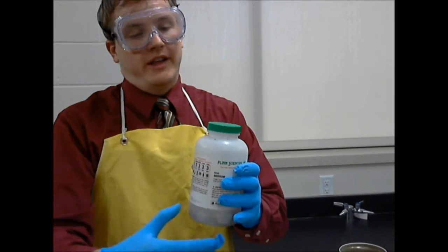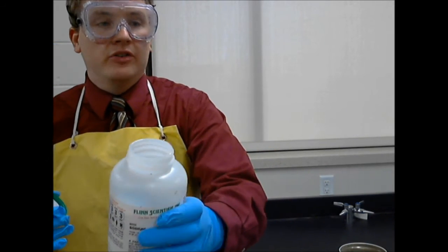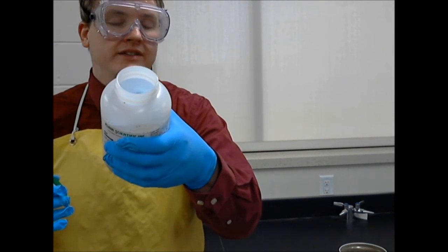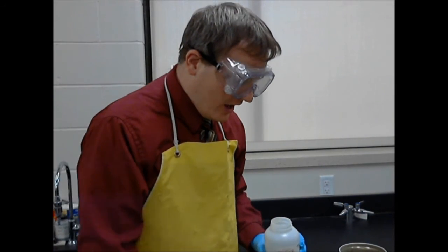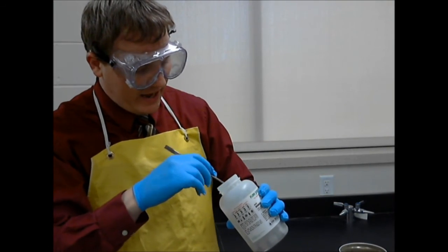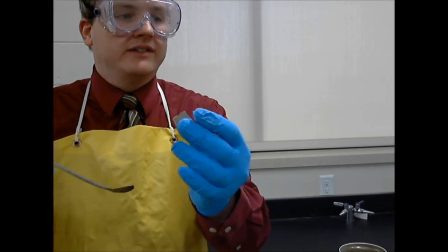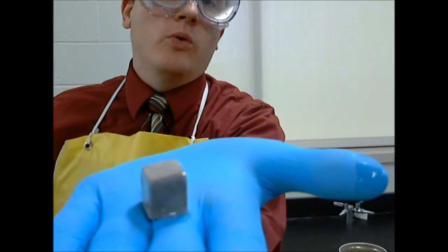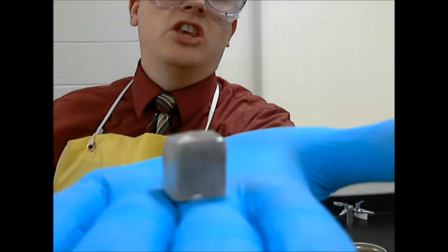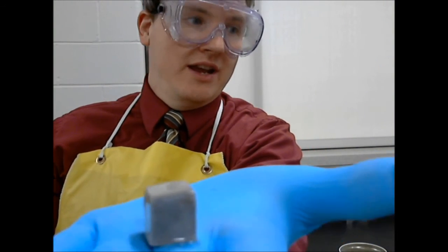But that's not all. Inside the sodium container, it's full of mineral oil to prevent the sodium from contacting any moisture in the air at all. So to even get the sodium out, you first need to remove it from inside the mineral oil. And then finally, on the very inside of the container, we have our chunks of actual sodium metal. This is a cube of pure sodium still coated in mineral oil from inside the container.